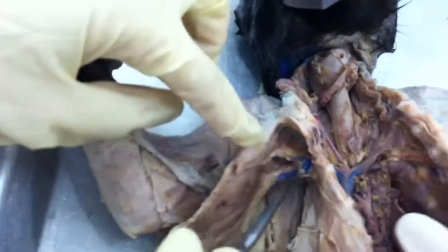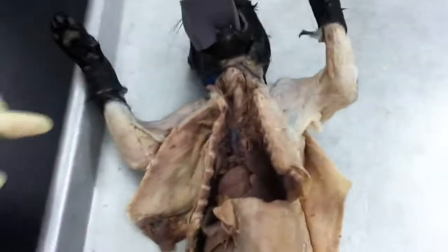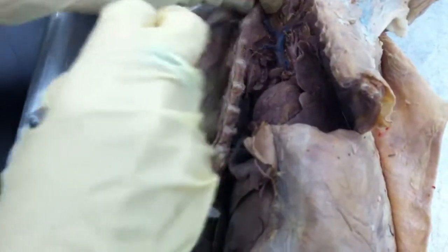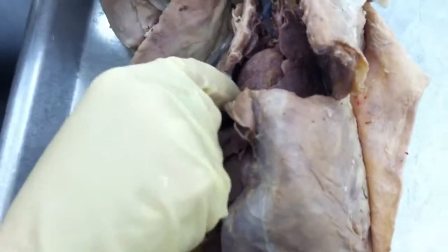Okay, and the axillary is that one? Mm-hmm. So this is the vein though right there. Your axillary, if you remember from AP1, means armpit area. So the benchmark for me is the rib cage. So right here. It's kind of hard to see, but it's usually right next to the vein. And it'll be pretty obvious if the pin is in the vein.